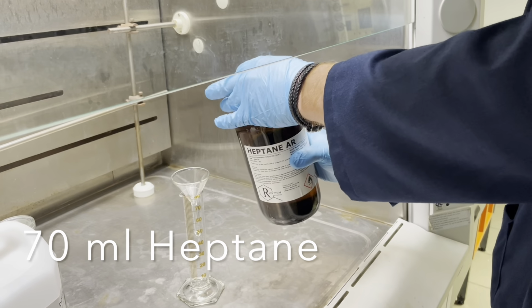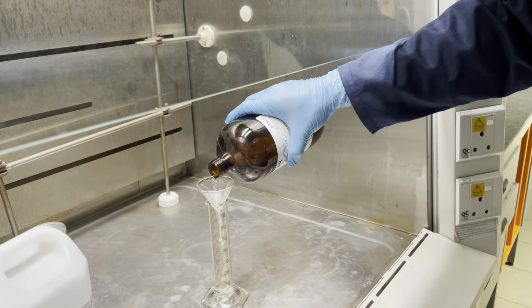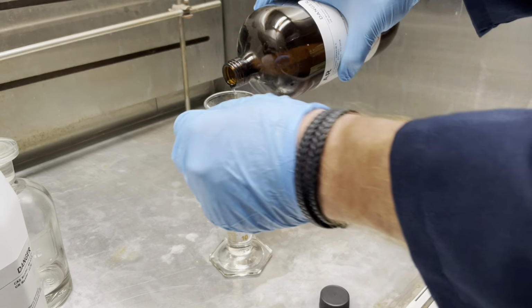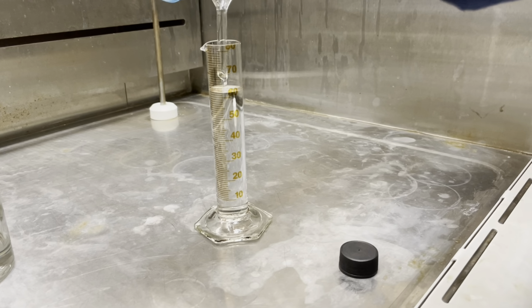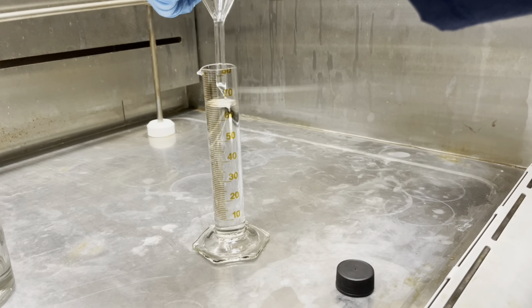Next, while your product is filtering, collect your 70 milliliters of heptane, again using a funnel and a measuring cylinder in the reagent fume hood, which you will use to precipitate your product. You will also use an ice acetone or ice salt bath, which you can also prepare in the meanwhile.